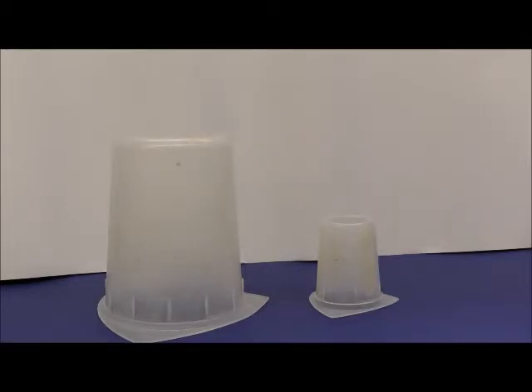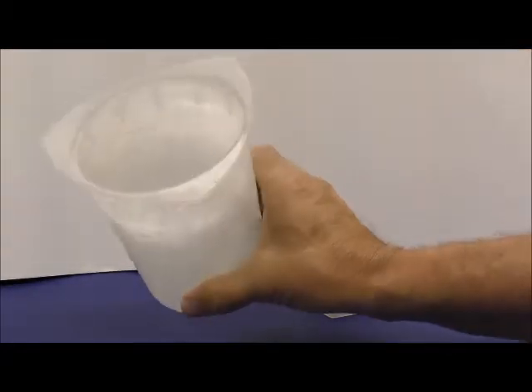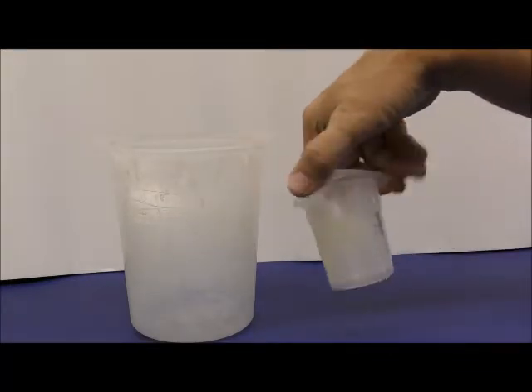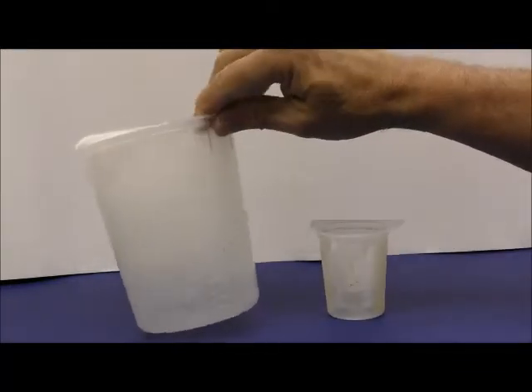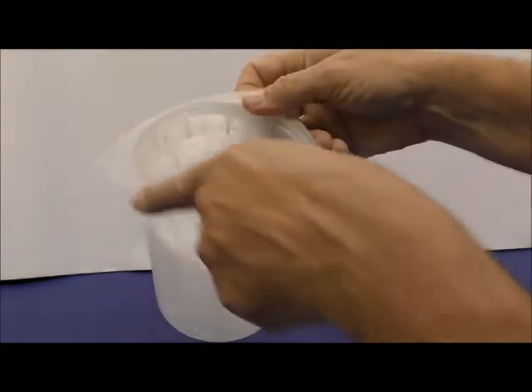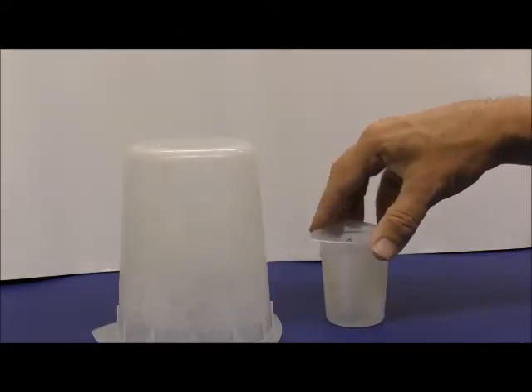To make fly containers for egg pulses, one can use these types of containers that you can get from a supply house. This is 100 mils. This one is a liter. And what you can do is cut off the edges of this if you like, and same on this one, or just leave this one the way it is.